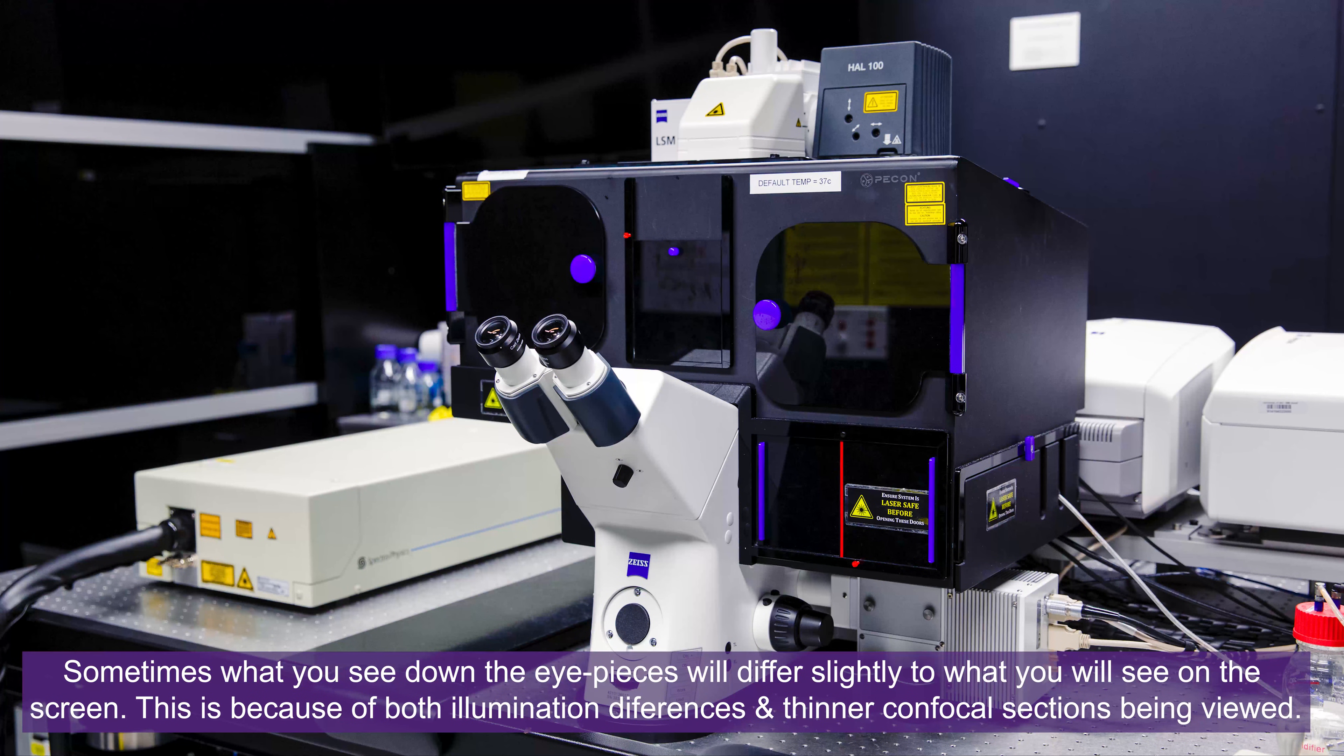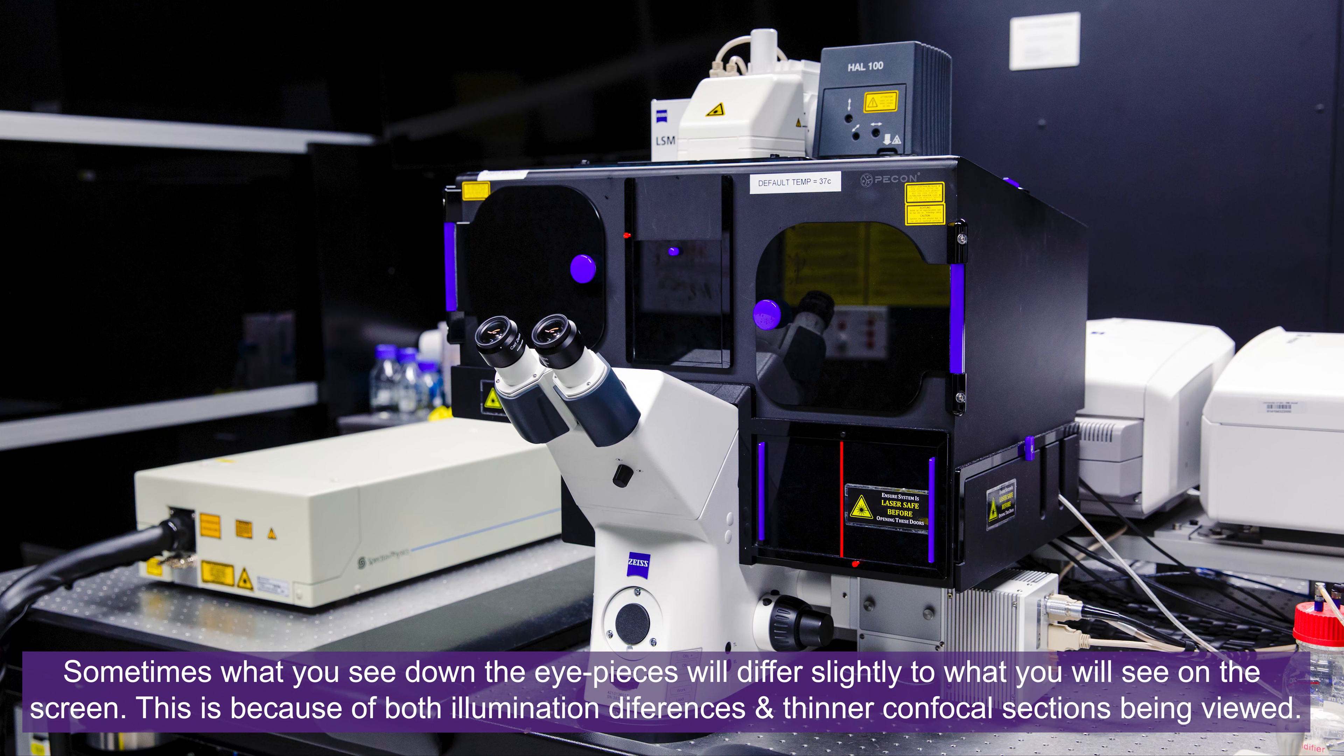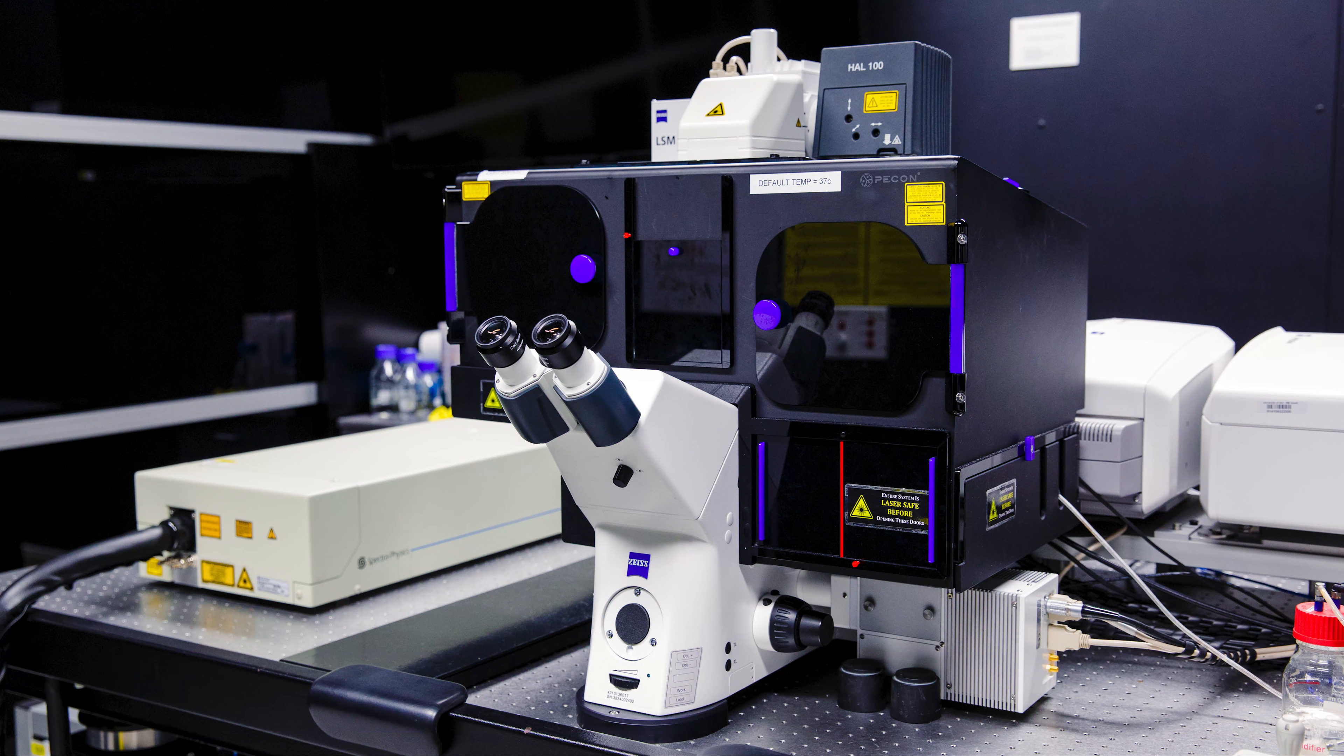These microscopes use fluorescence lamps for finding your samples through the eyepieces via filter cubes such as DAPI, GFP, or M-Cherry. These are all software controlled. They also have a bright field lamp for transmitted light imaging. For acquiring images using the confocal scan head, samples are illuminated with specific laser lines, and these vary slightly from system to system.